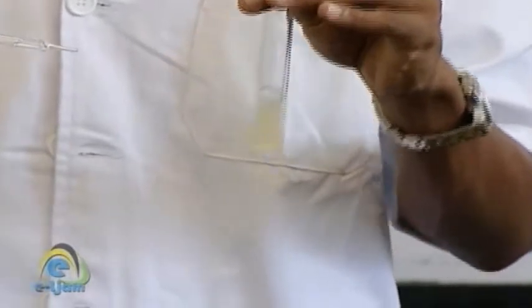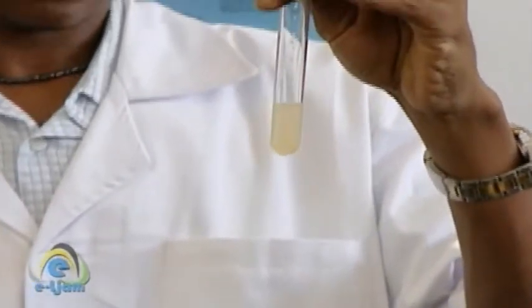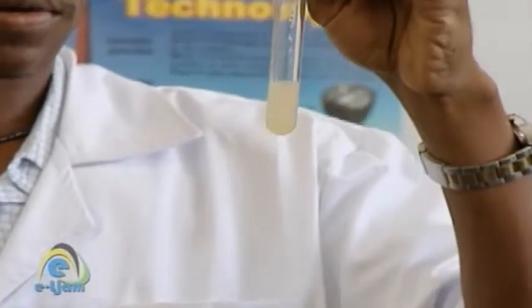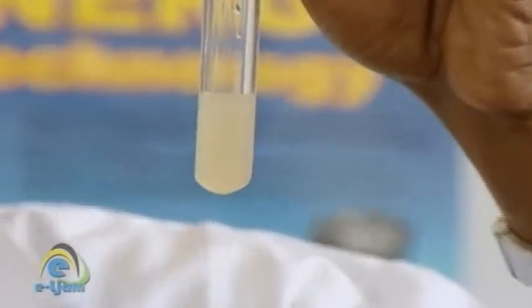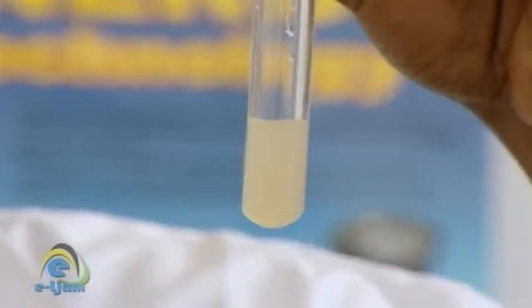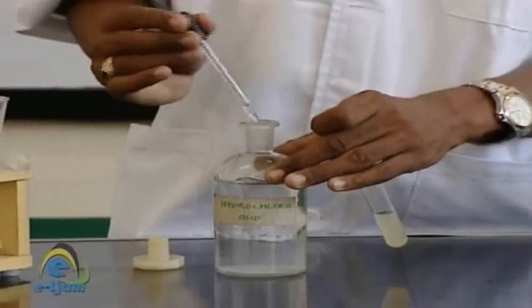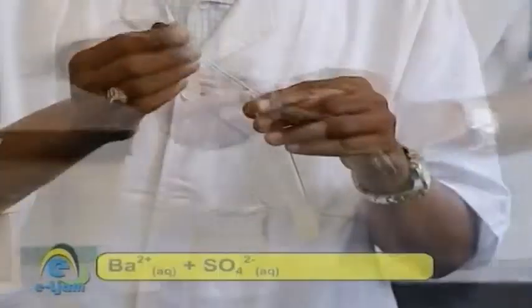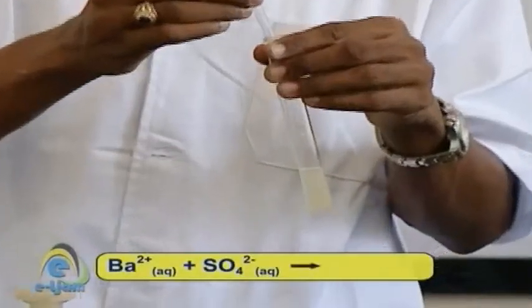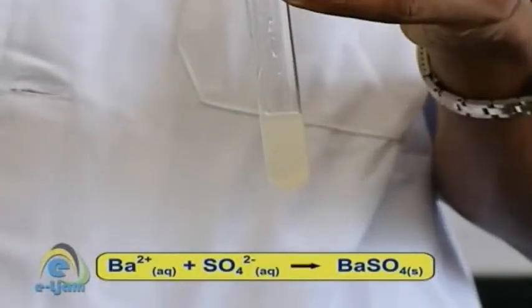To confirm: to the fourth portion, add barium chloride solution followed by dilute hydrochloric acid. Observation: white powdery precipitate formed. Inference: carbonate, sulfite, or sulfate possibly present. Observation: unchanged in acid. Inference: sulfate ion confirmed.